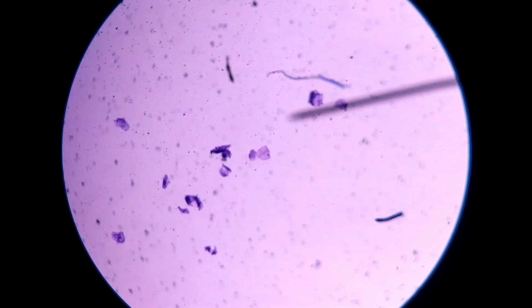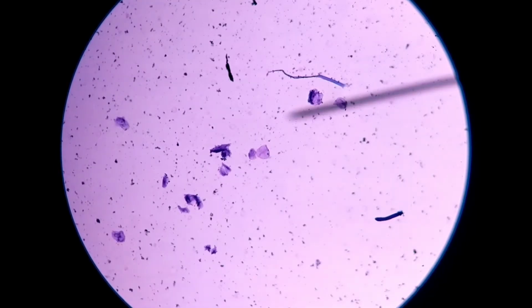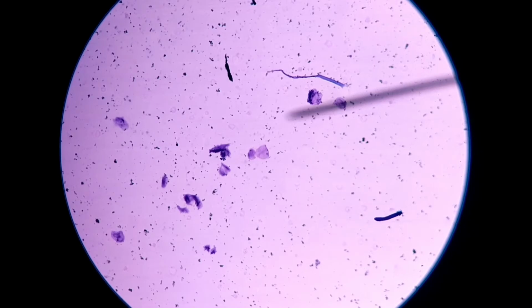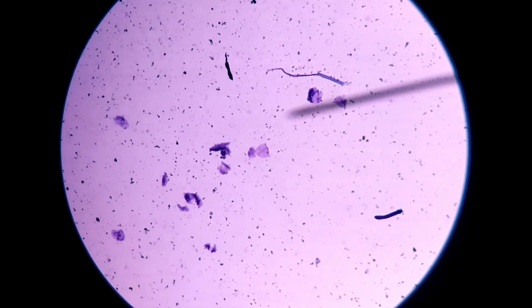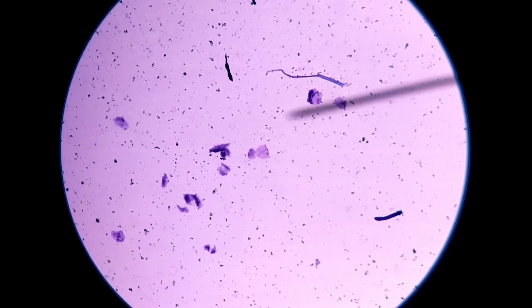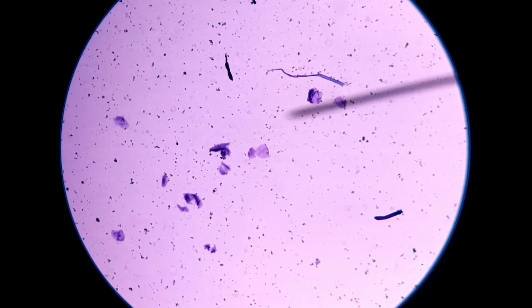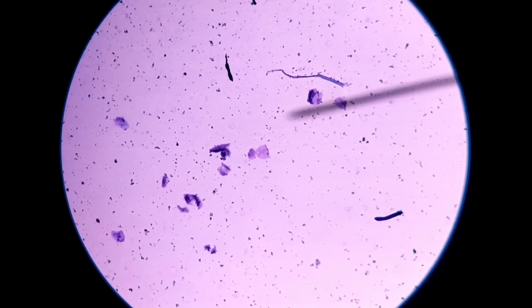I'm doing some fine focusing, and now you can see the cheek cells at low power. So this is 100x. They still don't look very large or detailed. I can see what looks like a hair just above the pointer. And anyhow, we have all these different cheek cells in here. And then now I'm going to go to higher power. You really need a high power lens, like 400x total magnification, or even the highest magnification, which is oil immersion. And so we're going to be looking at this under high power and then oil immersion in just a few moments.